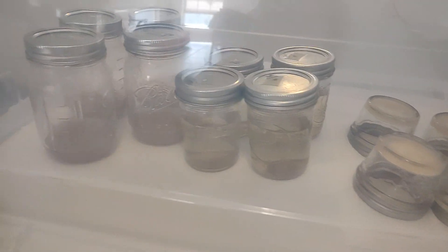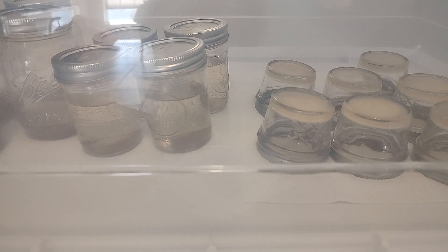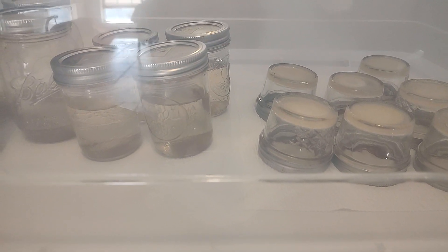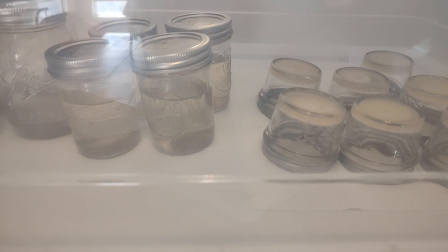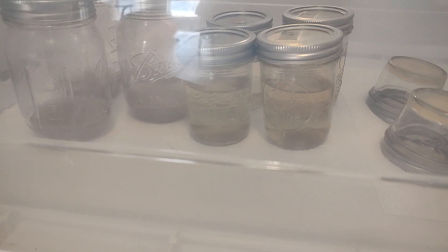I will be putting them in the LC and slurry. The slurry is just like a giant agar dish at the bottom — I'll do a video on that for you. We're actually using Willie's World's recipe for the slurries. It's the first time we've done slurries so we'll let you know, but that's his recipe.